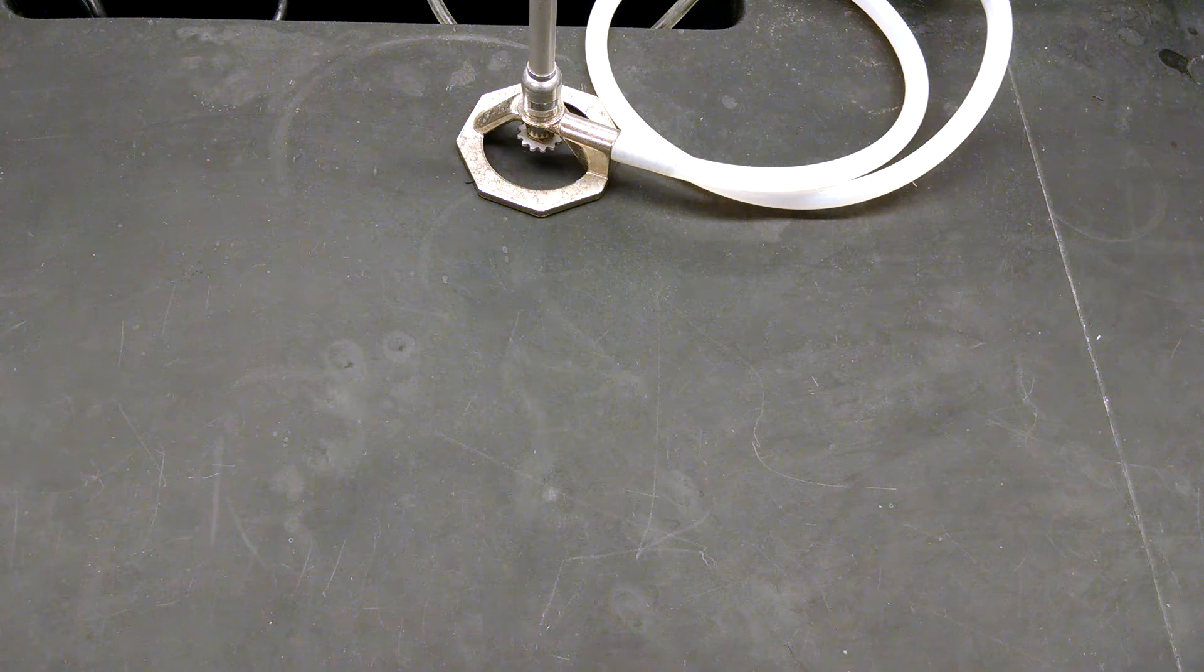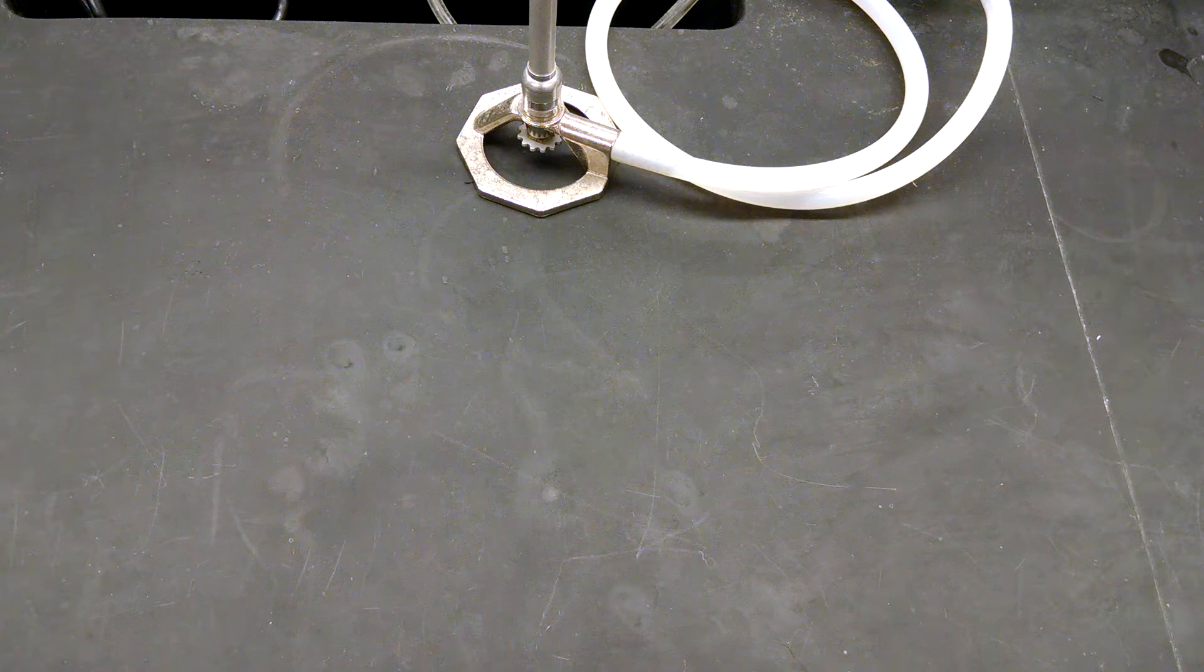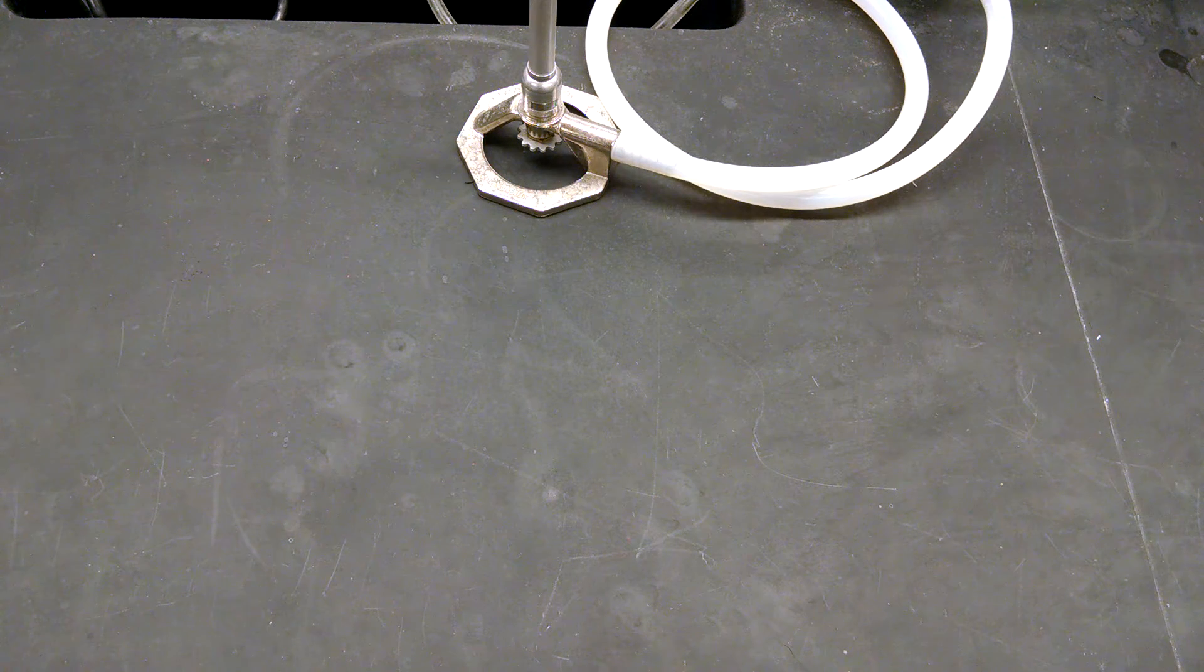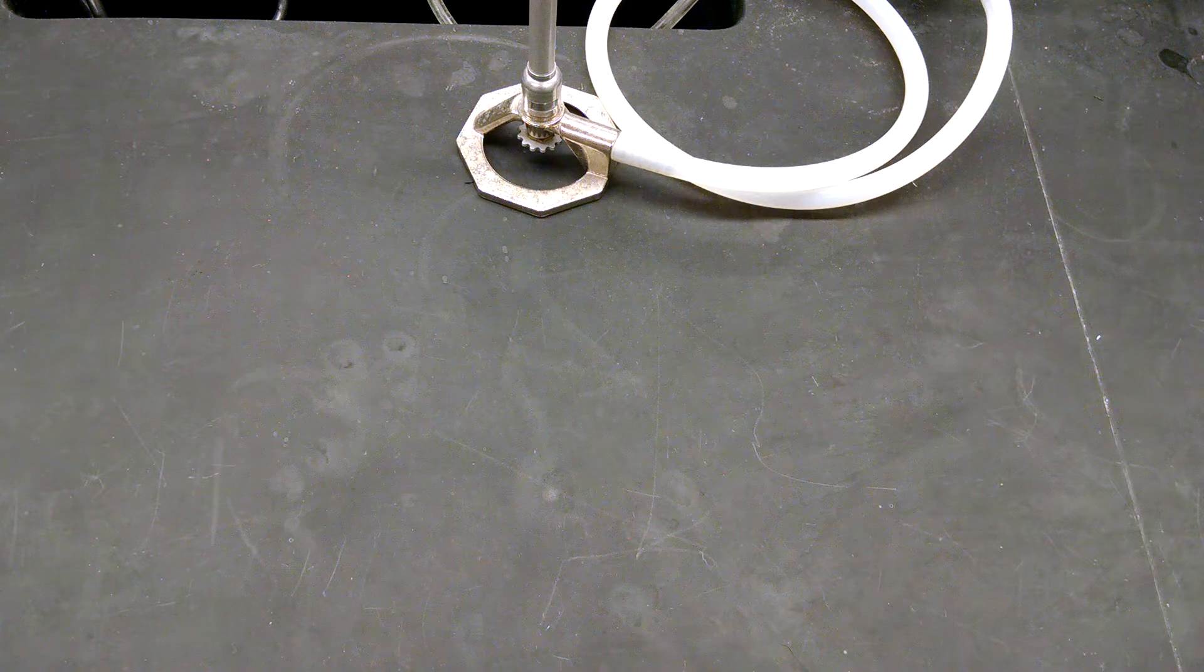Hello and welcome to the genetics lab video on how to patch your colonies. Today I'm going to show you how to patch your colonies to test their phenotypes.